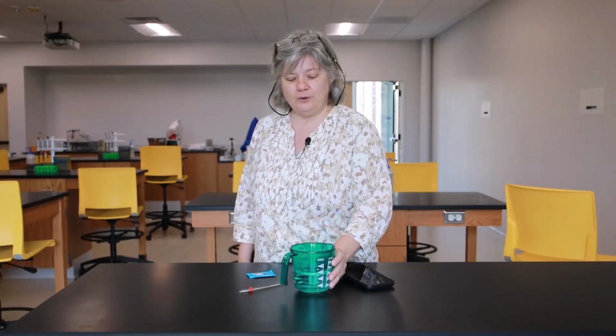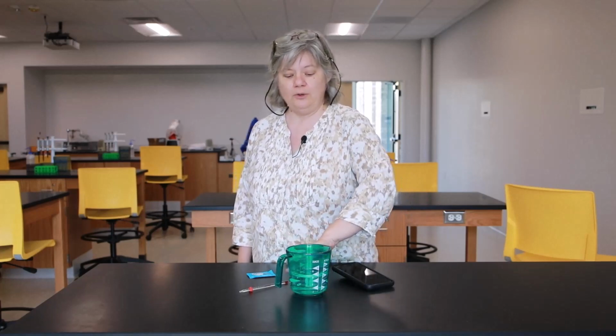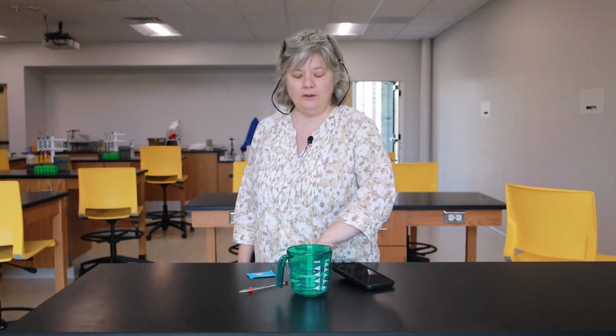Also, you are going to experiment with your water temperature at room temperature, hot and cold. So you will either need some ice to chill your water, or you will need to have put some of your water in the refrigerator in advance. Okay, so I'm just going to show you how to collect the data. I'm not going to show you the parts of the lab that require the cold and hot water.